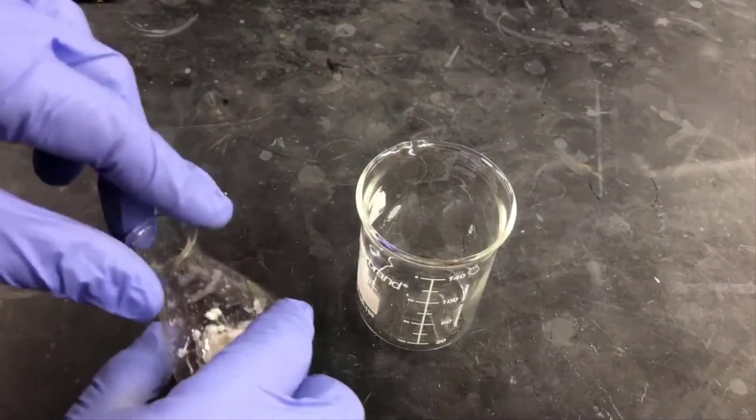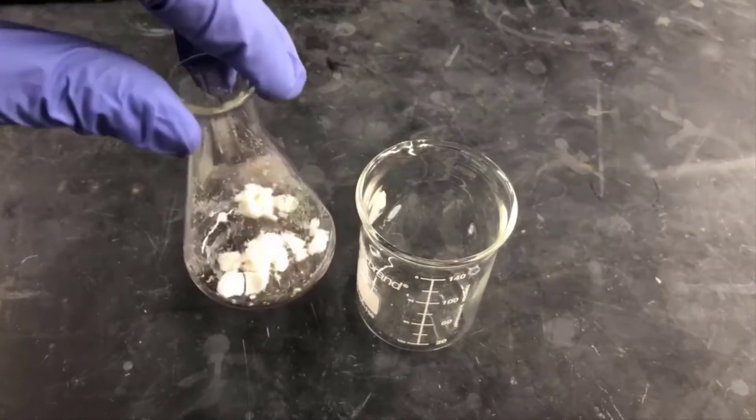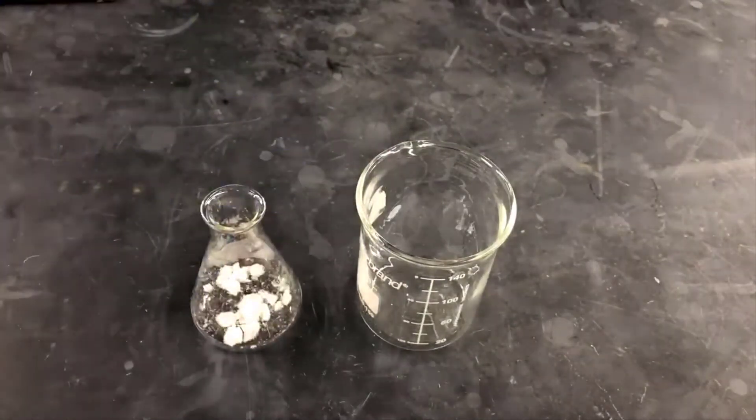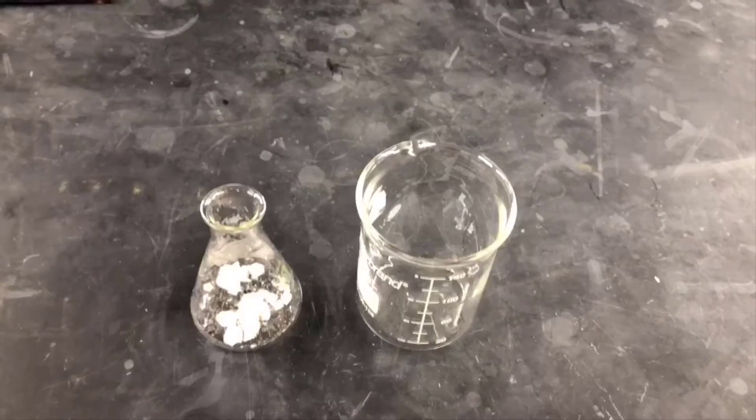The good solvent dissolves the product really well, the poor solvent dissolves it really poorly, and when I mix these two, I can find a solvent that has just the right characteristics to recrystallize the product. It should be a good solvent when it's hot, but a poor solvent when it's cold.